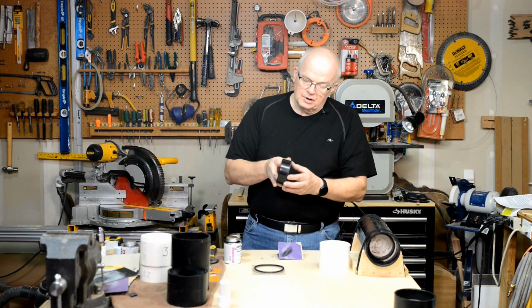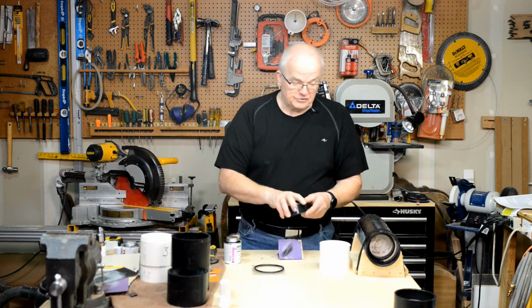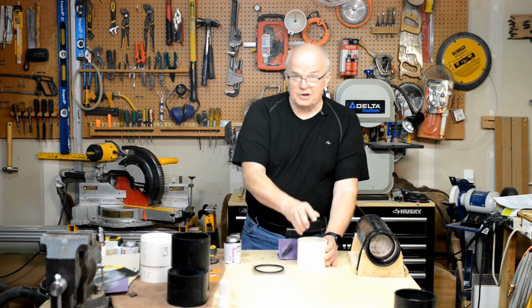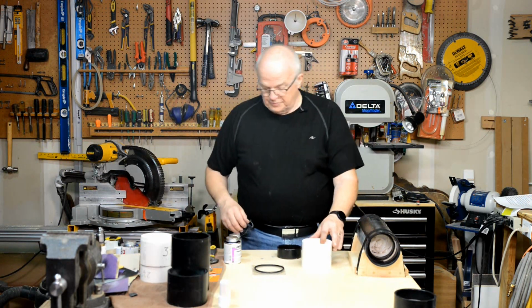Okay, that looks really good. You can see, well, you can't see it, but there's not very much. All it did was take off that sharp edge, and that's going to make it so that it will fit down inside of there without having to come in from the other side, which you don't want to do. Okay, so now that I put that bevel on there, we can get started.